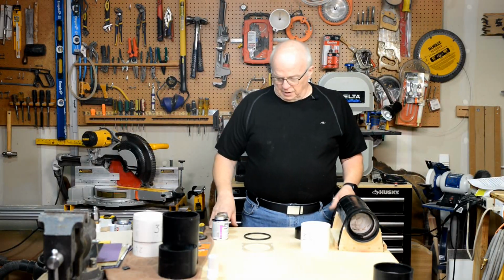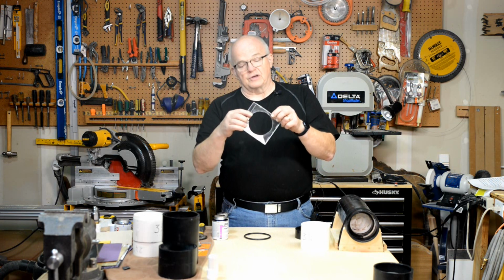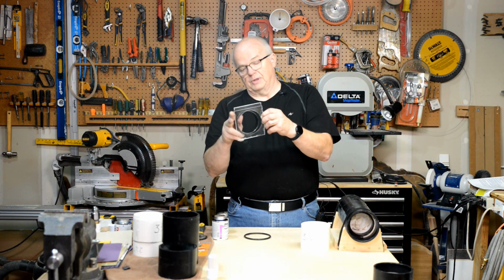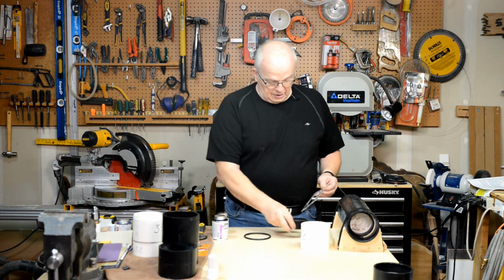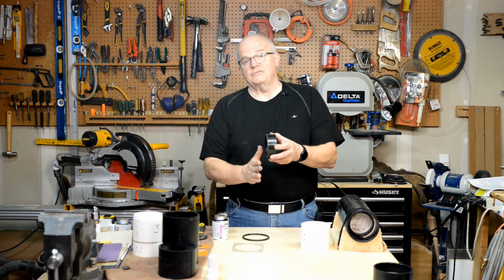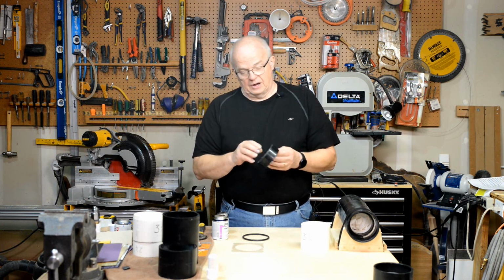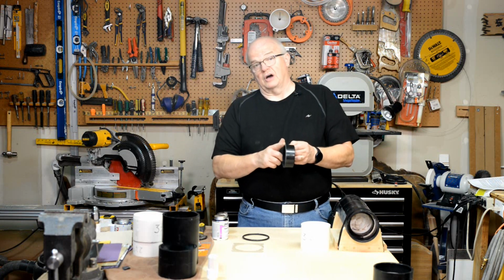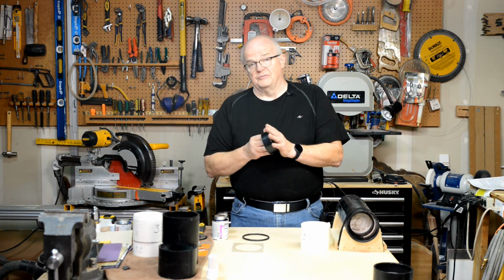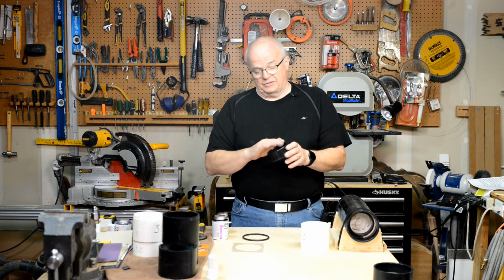All right, the next part of the process is to take that CD case that you've cut that circle around in, and it's just big enough for the end of this tom cap to fit through it, okay? And one of your O-rings. This is the tom cap that you've cut off. You've cut the end off that had the screw lid on it, because you just want this back end. Now, this piece has the end that you've cut, and it has the factory side. That factory side needs to stay clean. It needs to stay unmarred, unscratched, unmessed with. It can't have any glue on it or anything else like that.